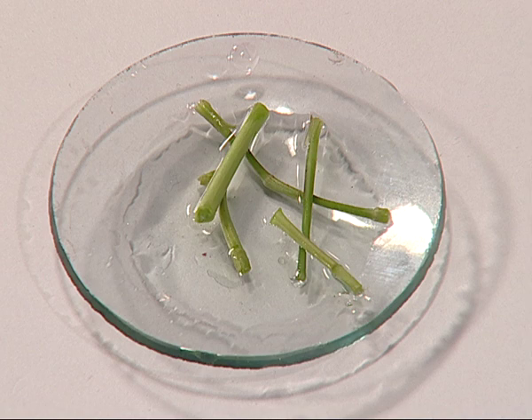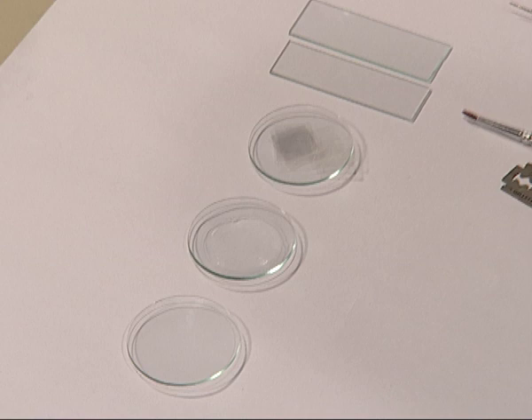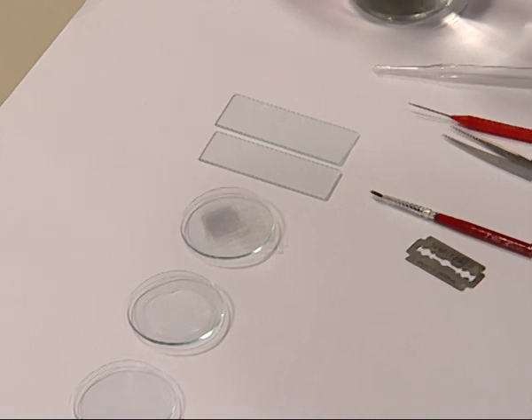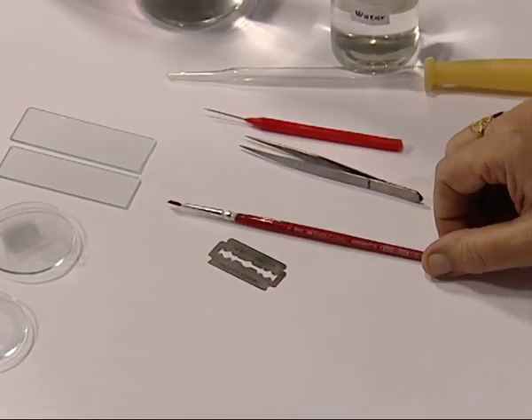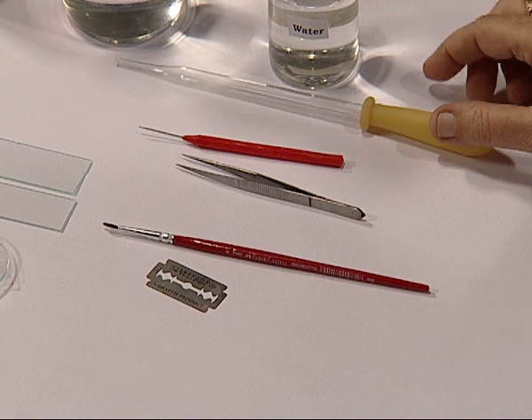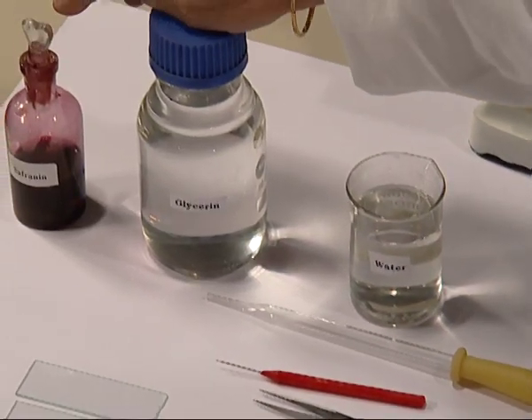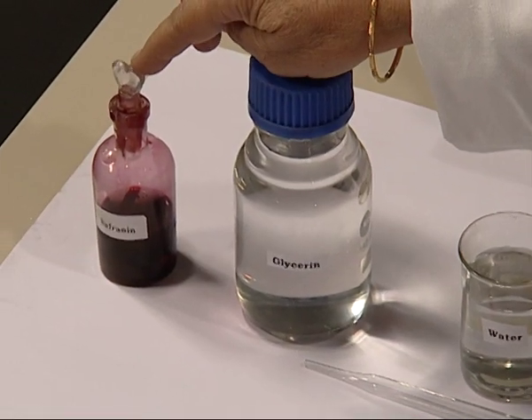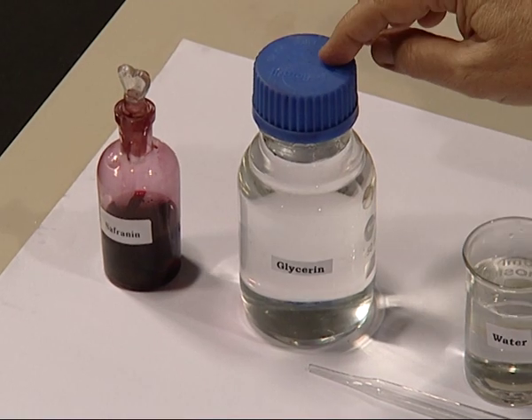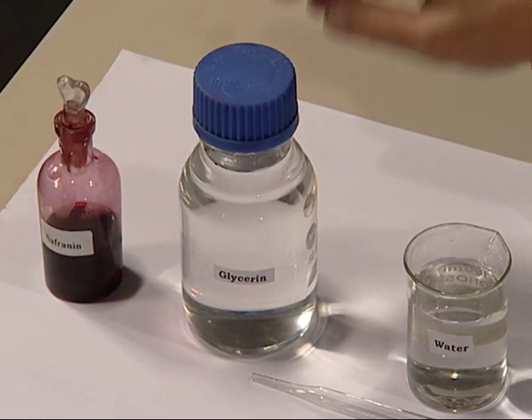We require some watch glasses, slides, cover slips, needle, forceps, brush, blade, dropper, stain such as safranine, and a mounting medium. For mounting, we require glycerin.